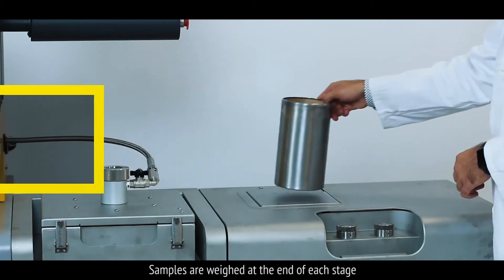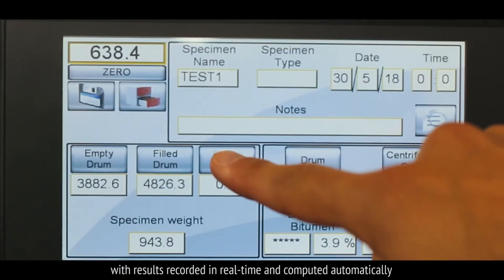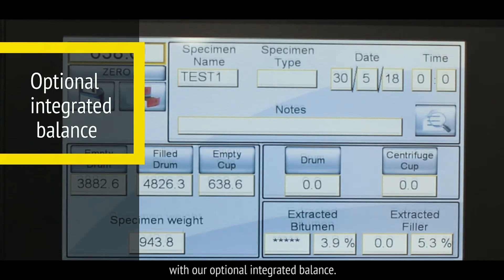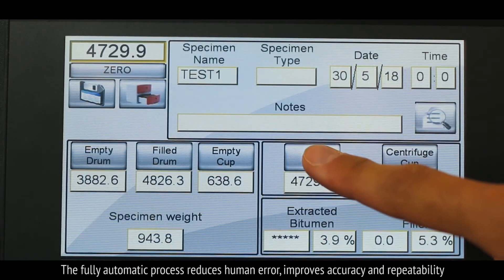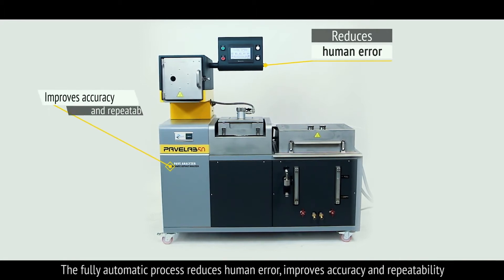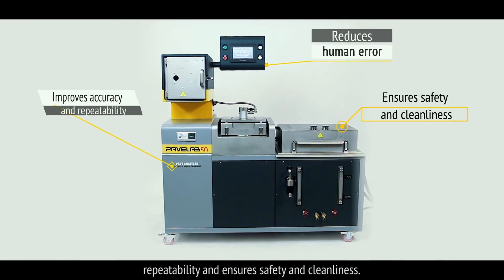Samples are weighed at the end of each stage, with results recorded in real time and computed automatically with our optional integrated balance. The fully automatic process reduces human error, improves accuracy and repeatability, and ensures safety and cleanliness.